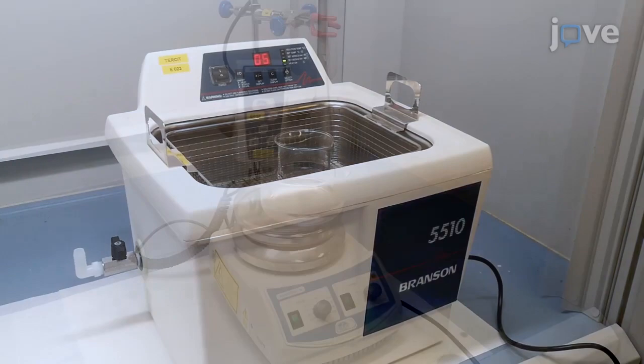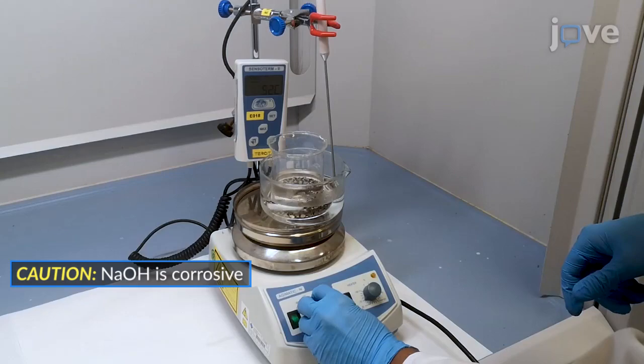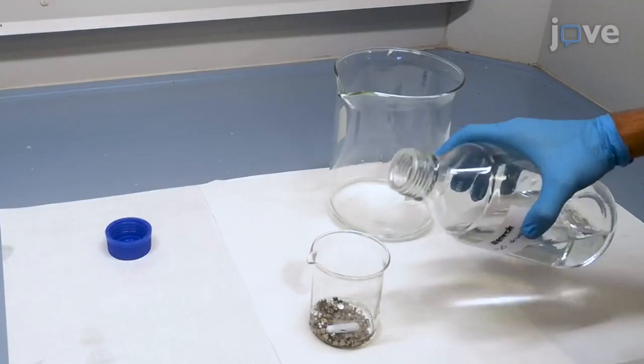After discarding the water, incubate titanium implants in a 40% sodium hydroxide solution at 50 degrees Celsius for 10 minutes with agitation, and then sonicate the implants in deionized water as demonstrated.